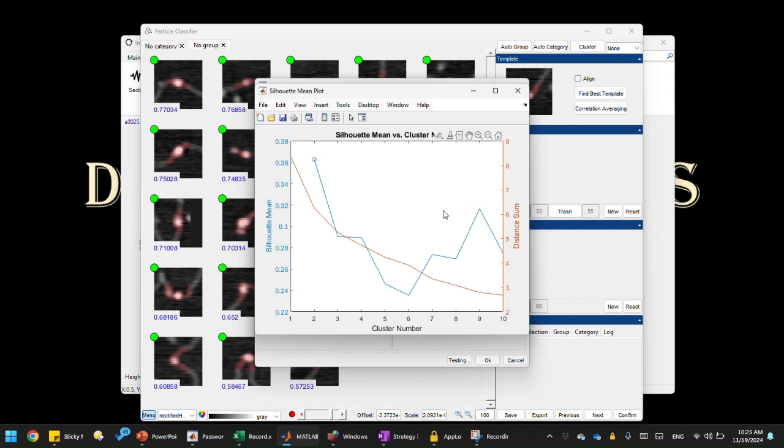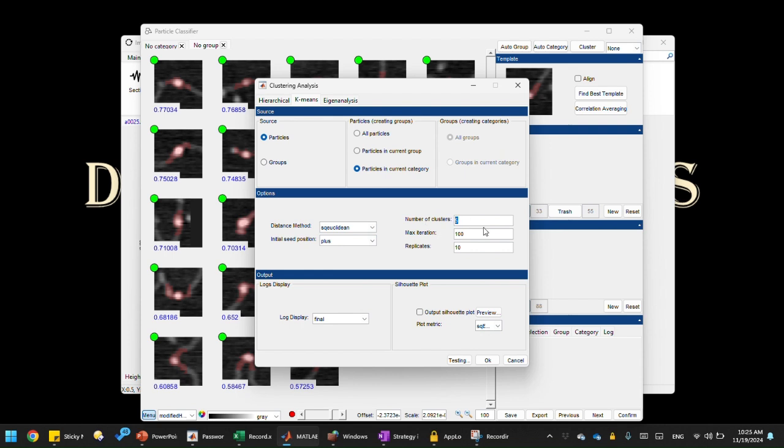If you want to know more about the technical details, like which number you should use, basically we need to use a number that has a higher silhouette mean value, which is this blue plot. You can read my thesis for more technical details. What's the best value we should use? We need to use a local maxima that can give us a large silhouette mean value. Right now it says 9 is a local peak, so we can use that number. The program says 9 is a good number, so let's do that. We say 9 clusters. Let's click OK.